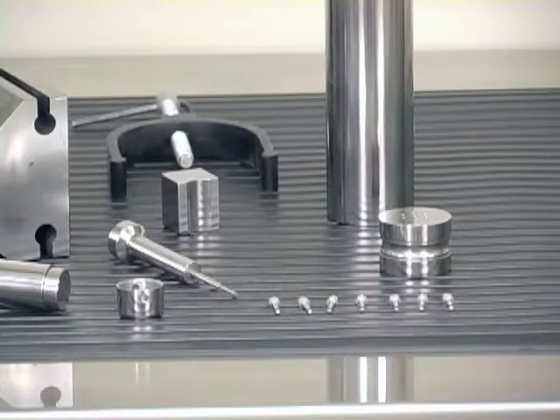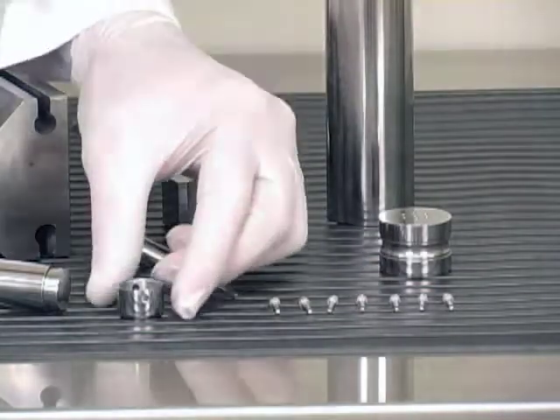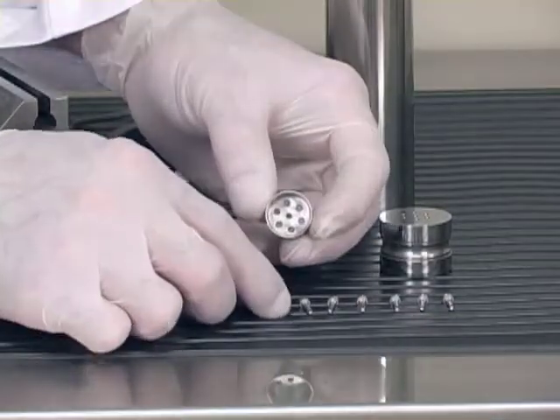Now to reassemble with your new inserts, you take the cap and you load the inserts into it.